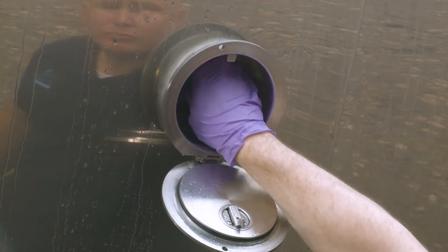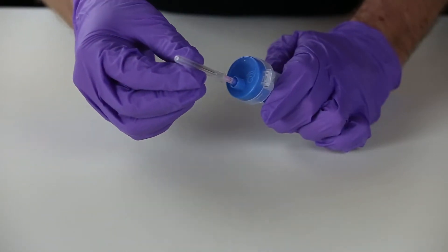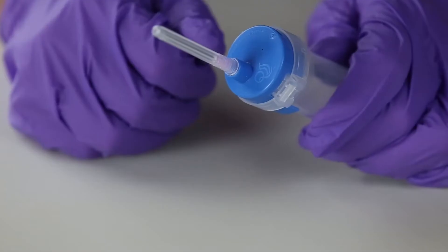Once you have collected the desired amount of liquid to be sampled, pull the needle and container out of the septum and carefully replace the needle safety cover.